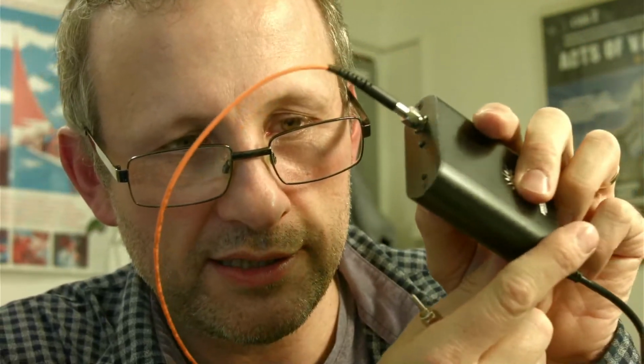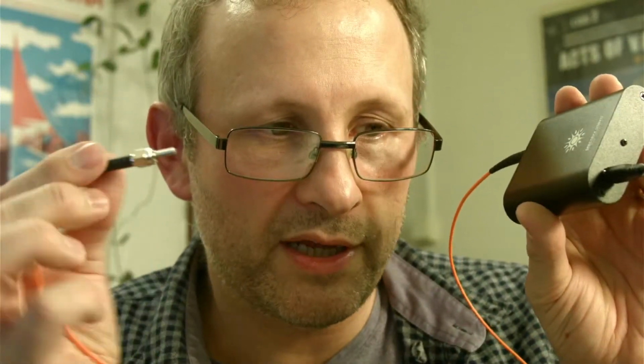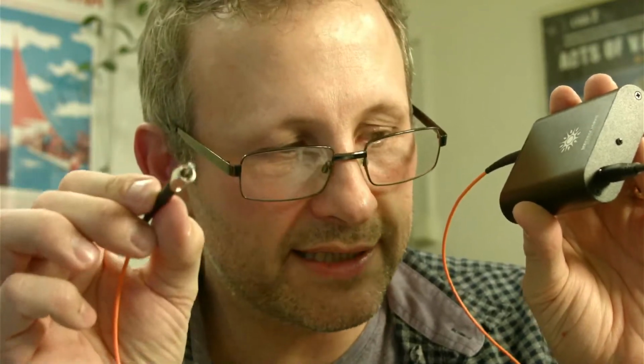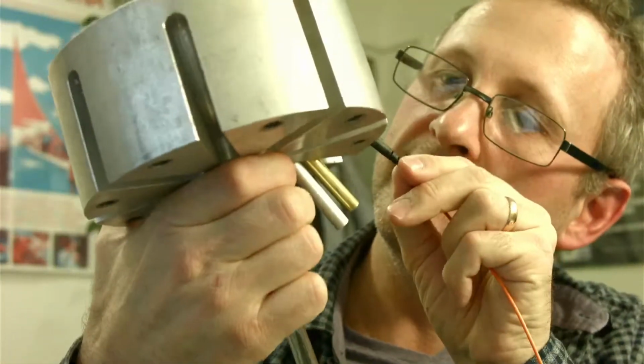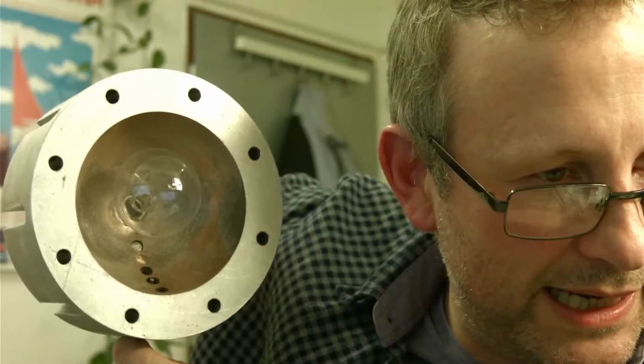It's very small, there's the palm of my hand. It has one port on the top, which is an optical port. You can maybe see that. And it has a micro USB, the sort that would go in a last generation mobile phone, at the bottom, and the power and the data go through that. Then at the other end you have your optical fiber, and this easily fits through one of the ports. I'll need to make a gland for that. So if I go here, you can see that I can actually insert it through this port, and you can see through, I can look. So I'm going to make a port.